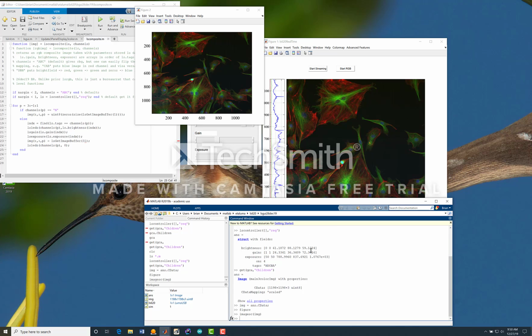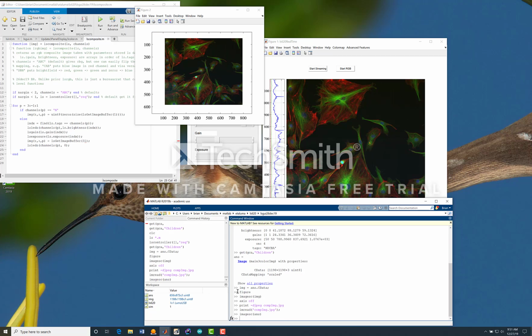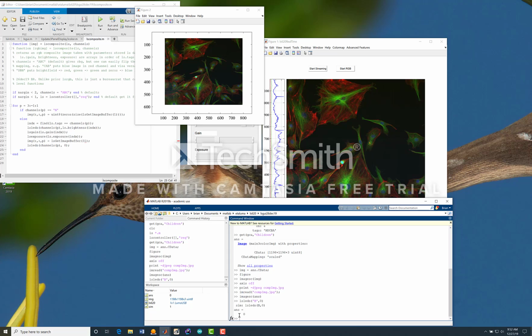We can take off the axes, and then we can save that as, say, a JPEG, print -djpeg comp image.jpg. So that's an idea of the integration with MATLAB's environment. We have access. We can also turn on LS LEDs if we notice, for instance, that LED B is on. We can shut them off, and since we're in sim mode, that just generated that little sequence, sim equals true or false, and that last command would actually attempt to talk to the microscope and execute that function.